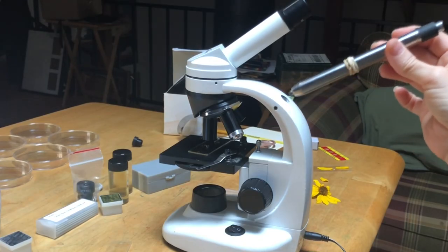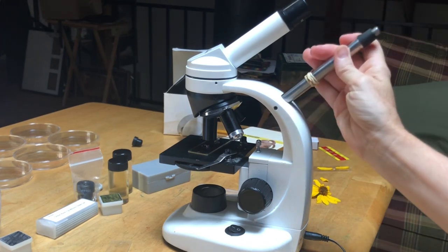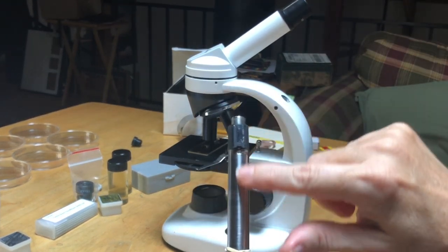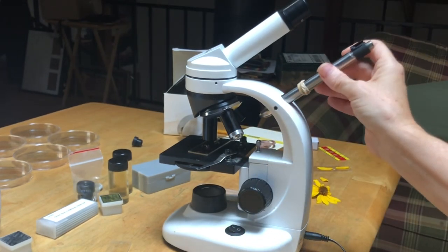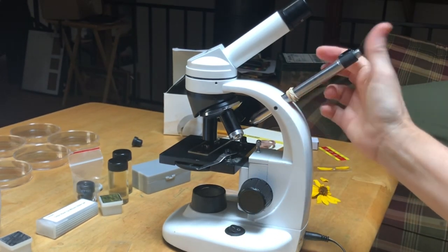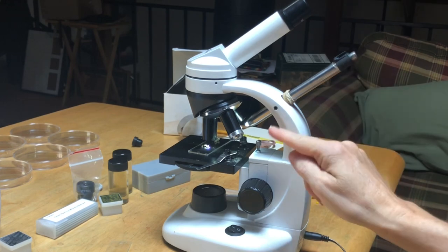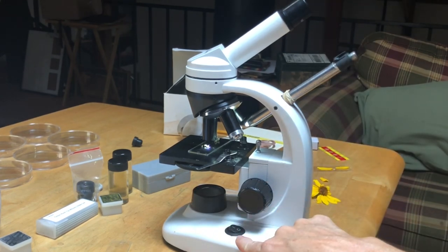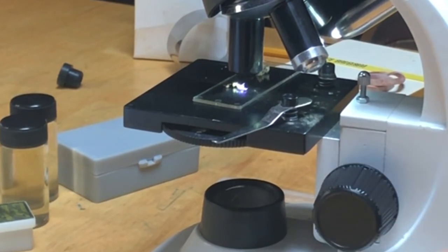And then I also have a top light source, which I highly recommend. This is just a light pen, but it is built for this. It had a clip that kept it in place but that broke, so we're using a rubber band. And you can see I have the light source here and the light source here.